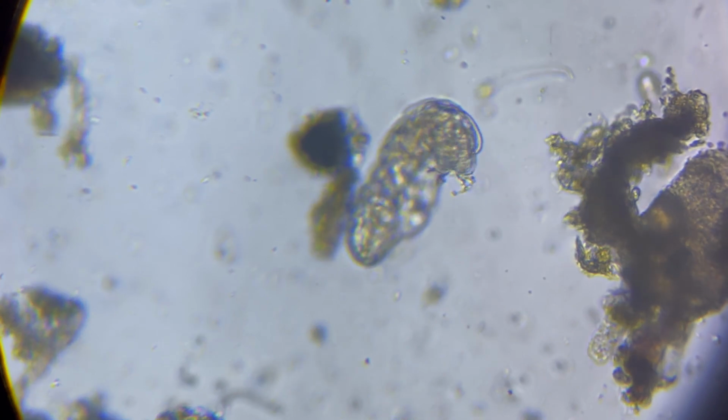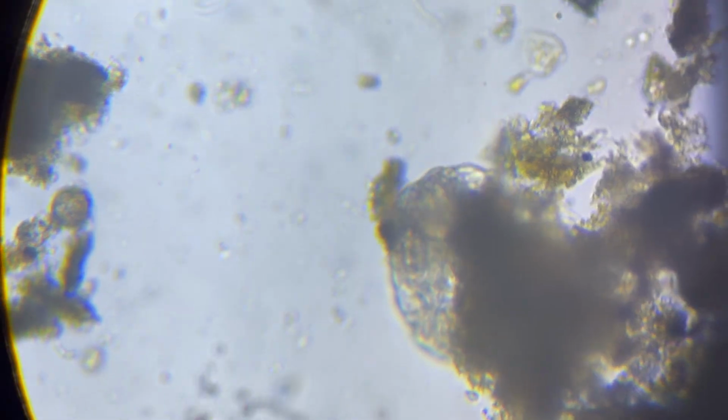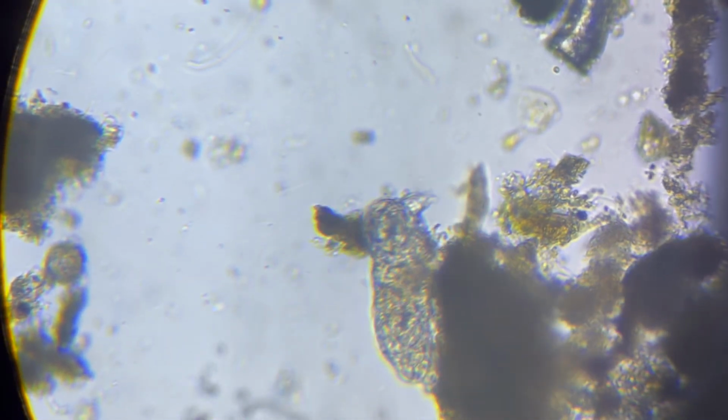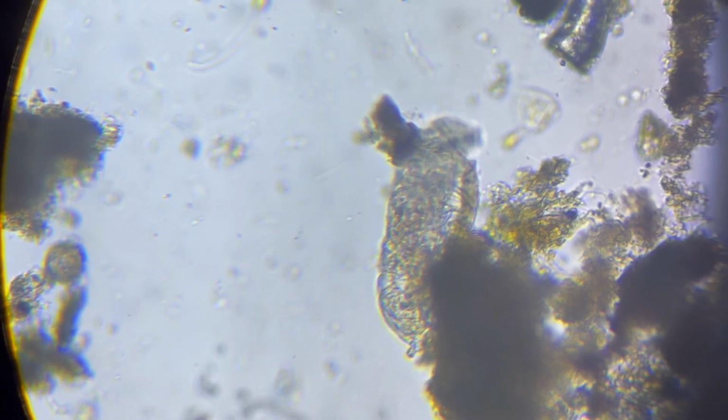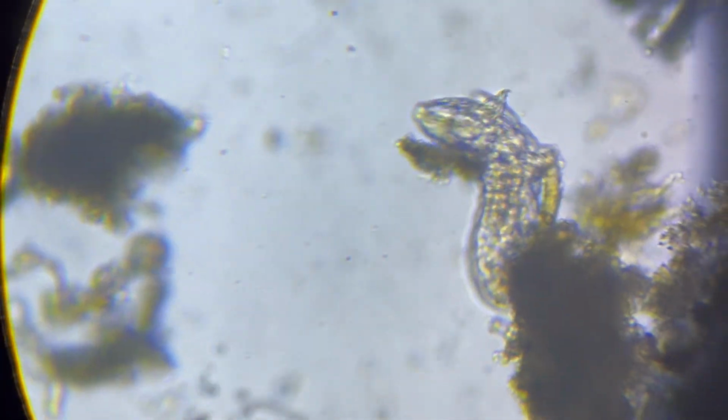This little tiny creature, they range in size from about 0.1 to 1.2 millimeters. This one was roughly 500 micrometers, or half a millimeter in size. Now, despite their tiny size, they've got 6 to 8 stubby little legs, and they've even got little tiny eyes, a mouth. They've got an entire digestive system. They are incredibly complex creatures.